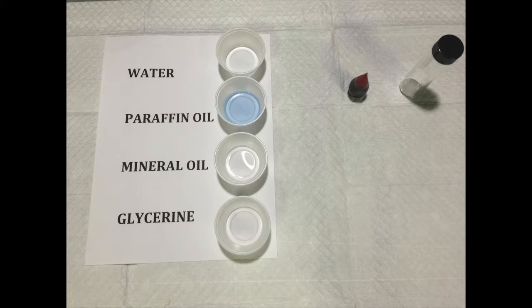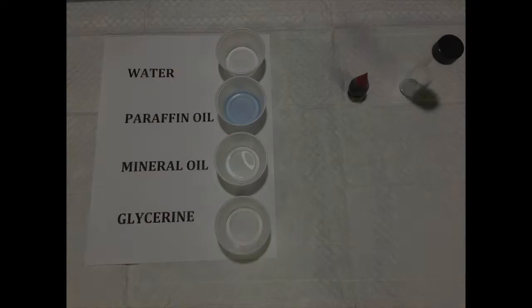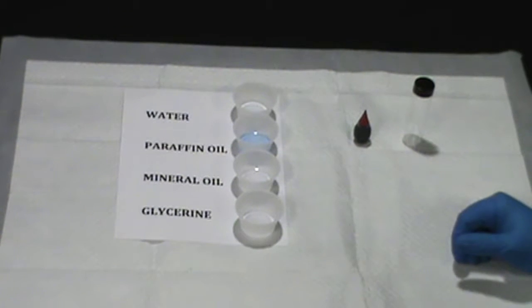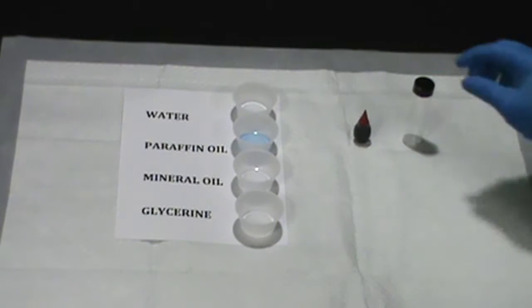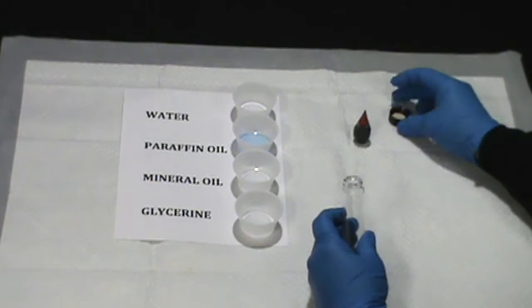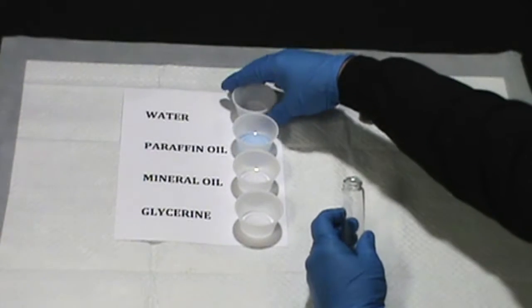The chemicals we will use in this demonstration are water as our standard, which will be colored with red food coloring for contrast, paraffin oil, mineral oil, and glycerin. The first step is to take 10 milliliters of water and pour into our glass vial. We will then add 1 drop of red food coloring to where we can see the contrast in comparison to the other materials we will add.